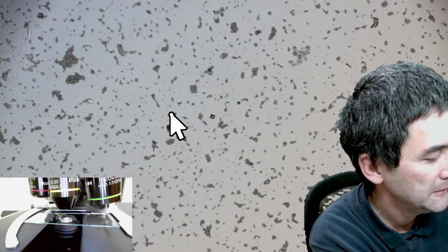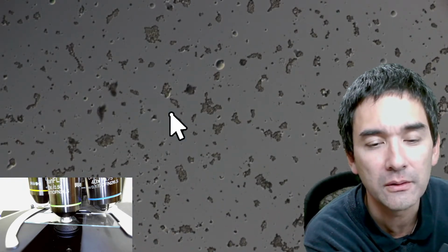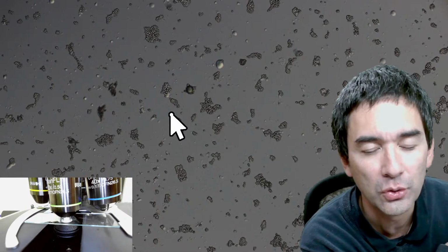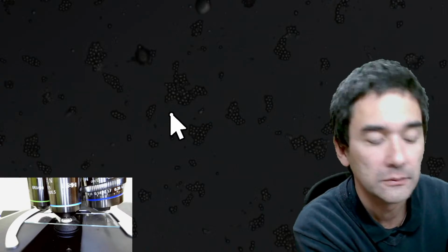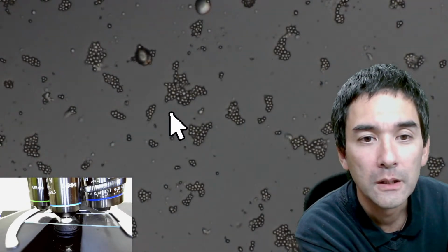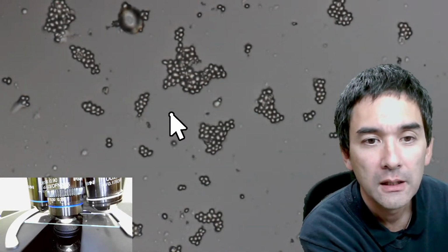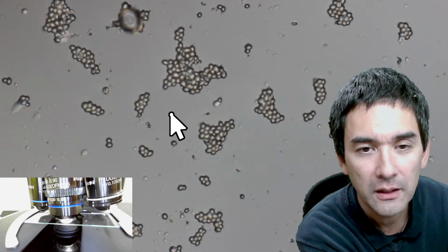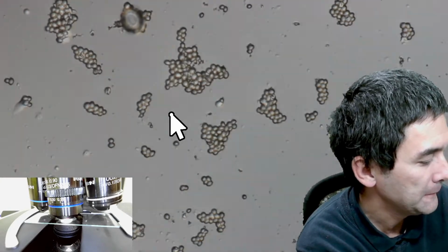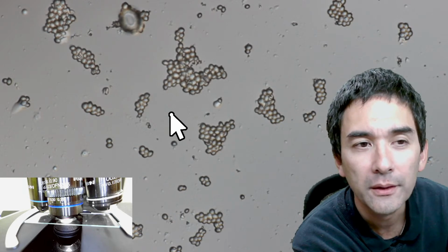Okay, so these are the dried yeast cells. As you see, when they dry, they actually start to go a little bit into clusters. So far nothing new. Generally, however, 60 times is the maximum I want to show you now. However, do notice one thing. Number one, it's a little bit blurry.